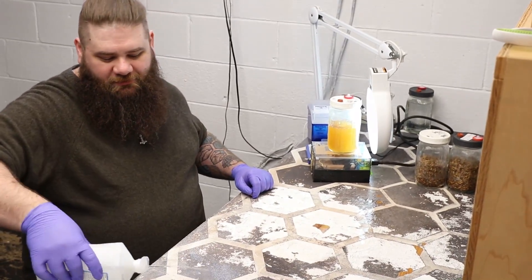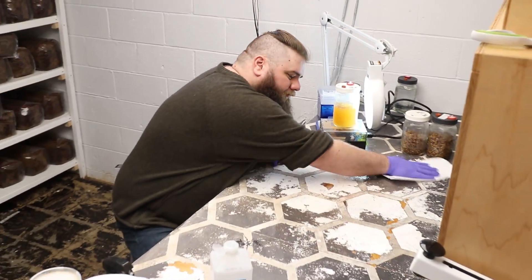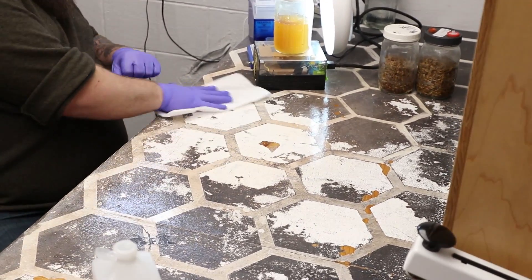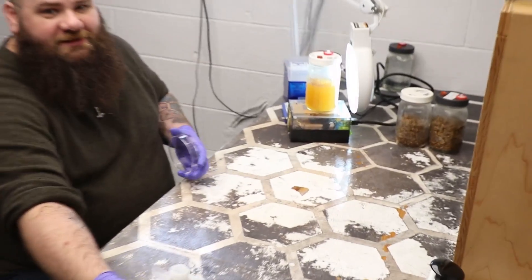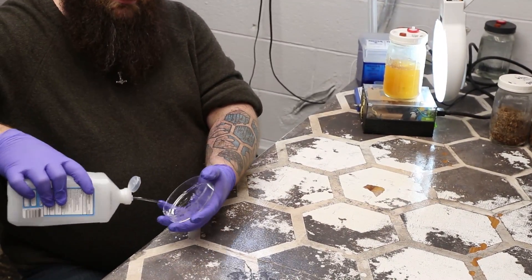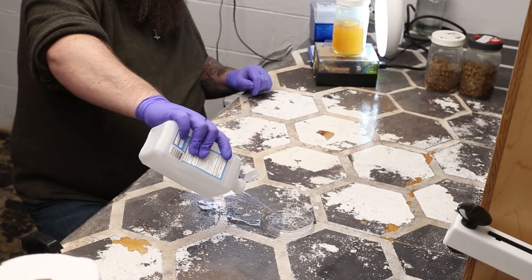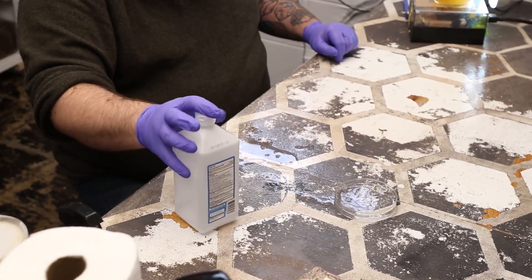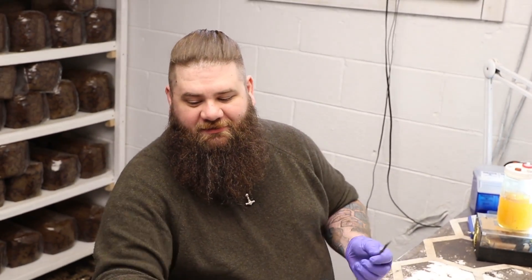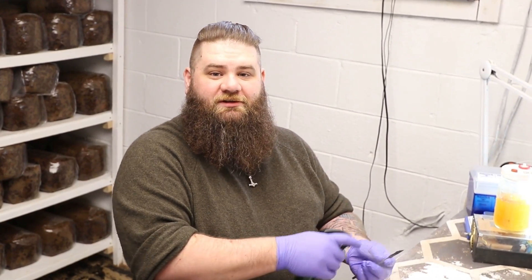When making your grain master from agar, there's a little bit more work involved — a few more steps. We begin, like always, by cleaning our workstation and gathering up our tools. I use a little alcohol tray here. Sometimes I need to dip something or throw something in a sanitizing agent. It's pretty rare, but alcohol is cheap, so it's always better to have it on hand and not need it than to need it and not have it.